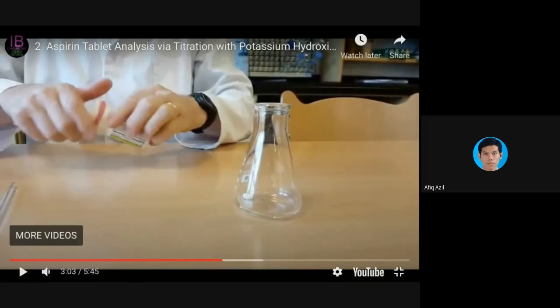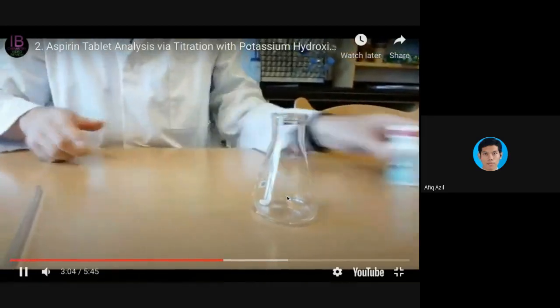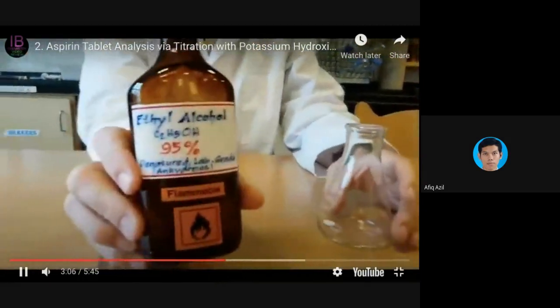But when you go to a working environment, especially in a pharmaceutical manufacturing company, the analysis won't be done this way. Most of the time you still have to take at least 20 tablets and then only take some of the powder from it in order to do your assay. But it's okay, I just want to use this video as comparison.